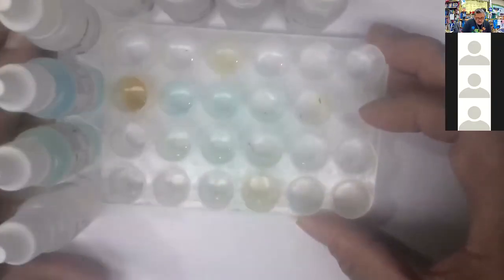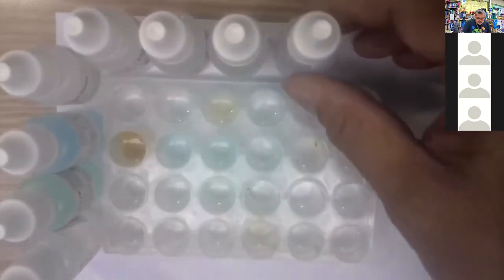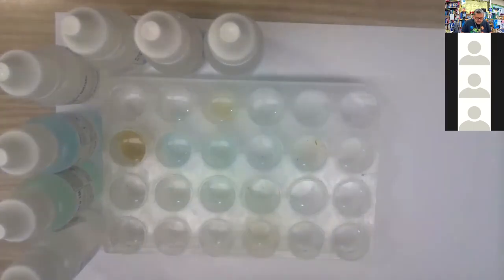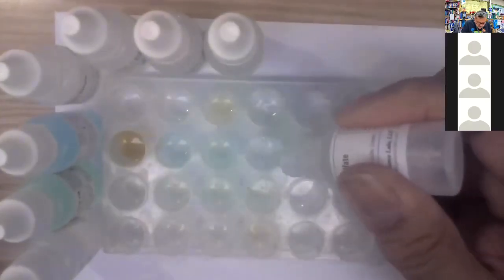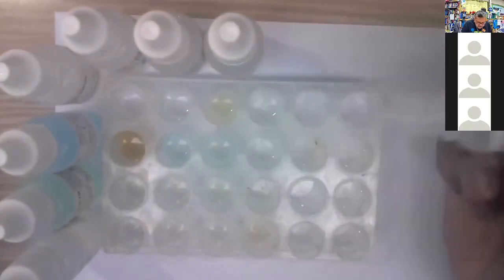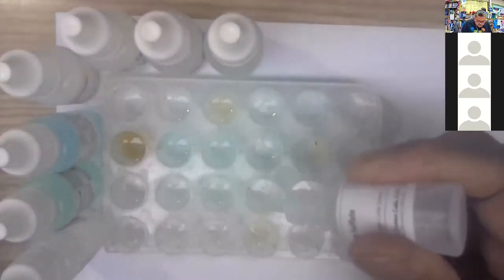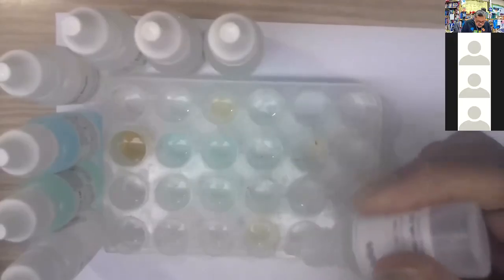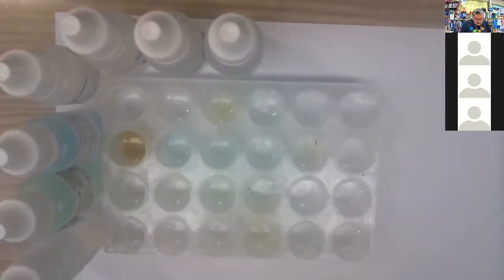And there we go, set that up so the bottle's in the right place. And so now we're going to go down here with 3 drops of each. Let's look for a color change in this row. Here we go. 1, 2, 3. Not really. 1, 2, 3. Maybe a precipitate. We'll see it better on the blue. 1, 2, 3, not really anything. And 1, 2, 3, not much there.